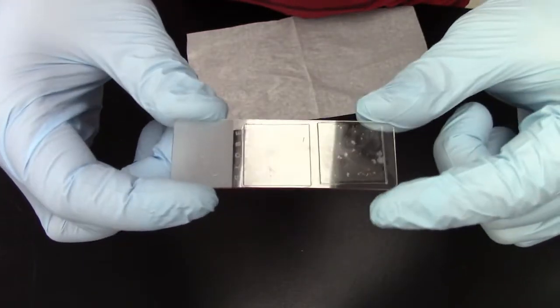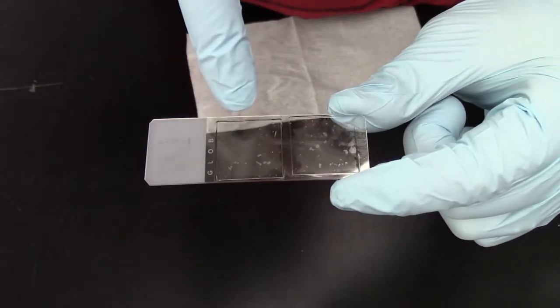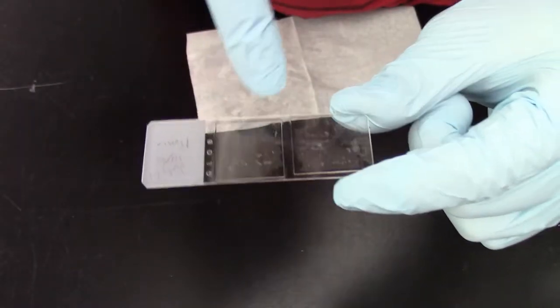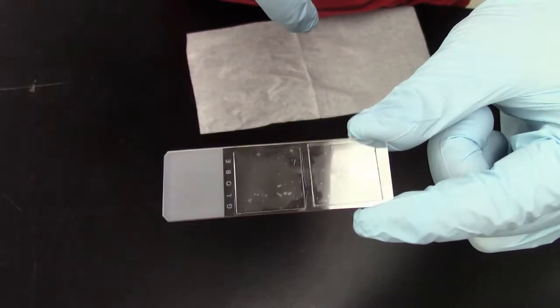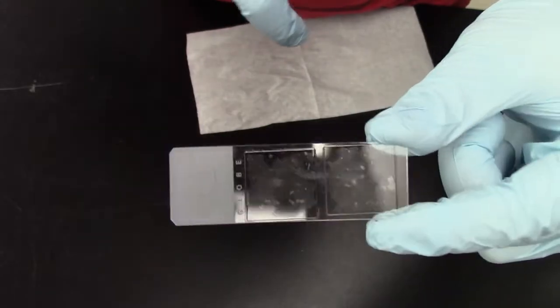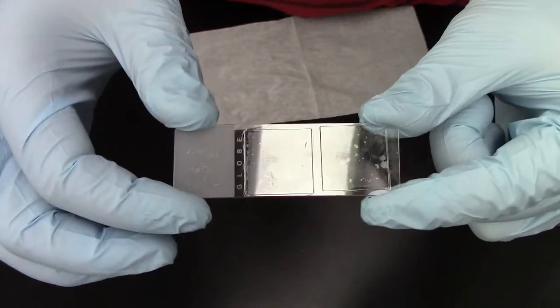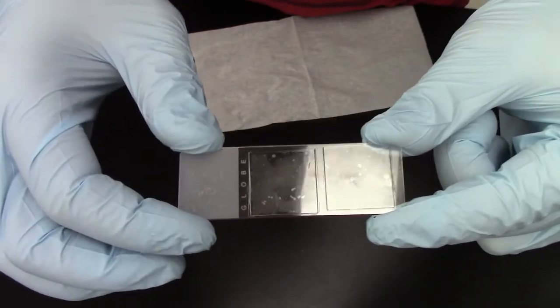So you look at the slide carefully and you realize that if you look at the coverslips you will see this little cloud. Can everybody see the cloud? It's like a little haze. This haze, this cloud is not good. Remember that your image is going to be only as good as your technique.